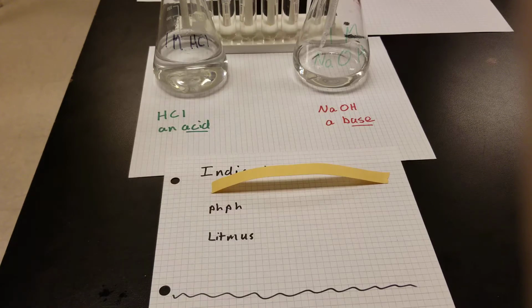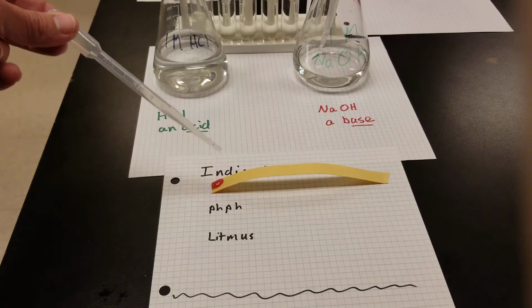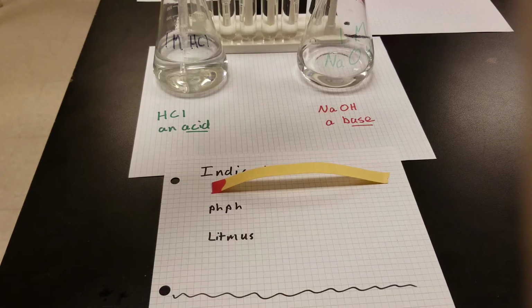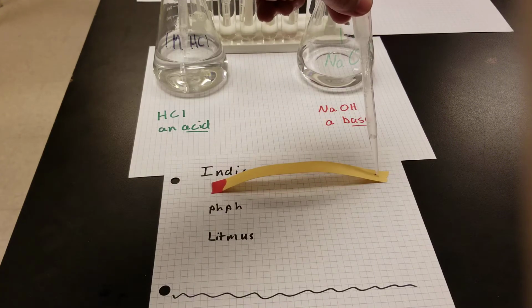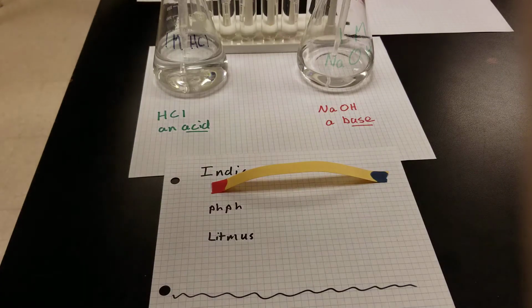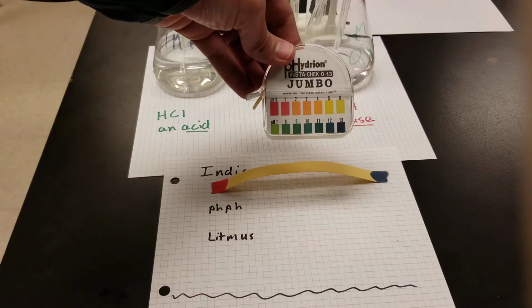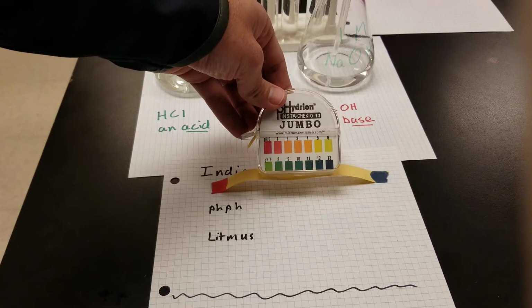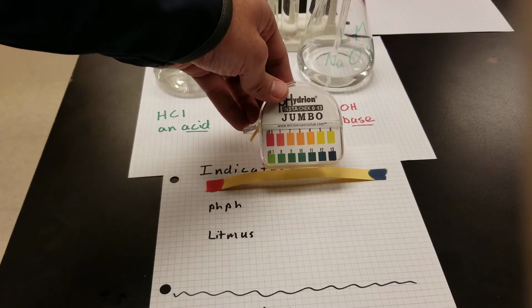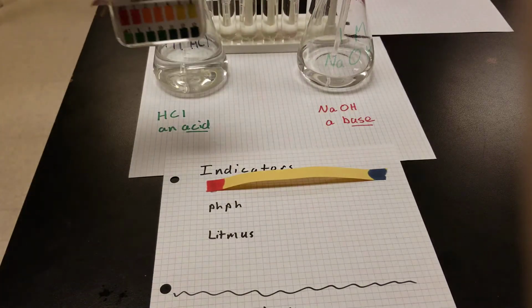And let's see, if I add some acid, that universal indicator, which kind of starts out at a yellowish color, it's going to turn bright red. If I add some base, it's going to change a different color because it has a number of different chemicals. This guy's nice and blue or lavender color. So here's my scale that's indicating for me that my pH of my acid is about 0, so that's a very acidic solution. And the pH of my base is at least 13. By comparing it with that color, I can see that the pH is at least 13.